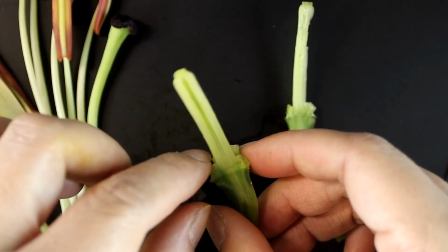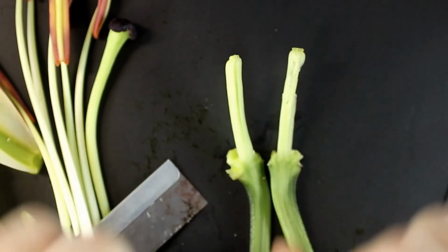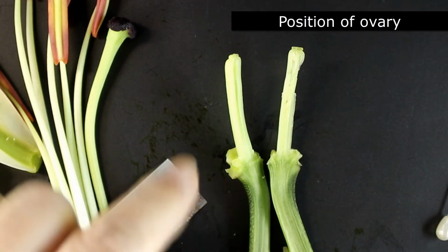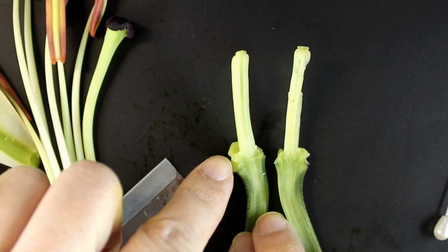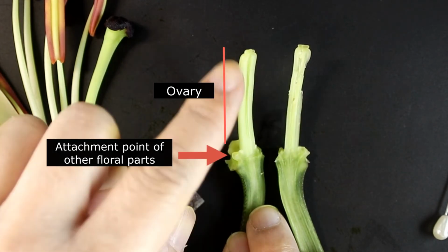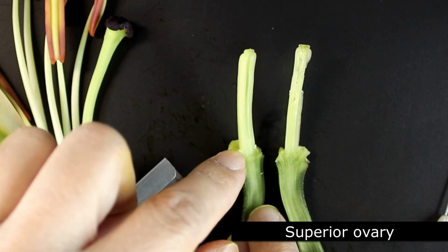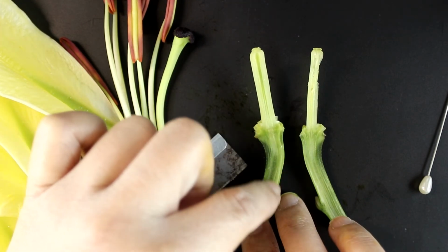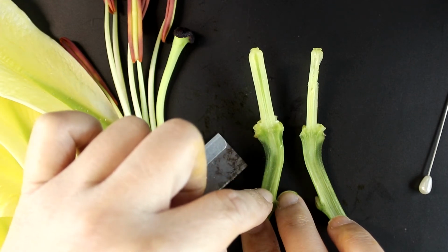So how can we describe the position of the ovary? As the ovary has been cut longitudinally, you can find its position clearly relative to the attachment point of other floral parts. You can see that the ovary is above the attachment point, so it is a kind of superior ovary. If you find the ovary embedded here, below the attachment point, then the ovary should be inferior.